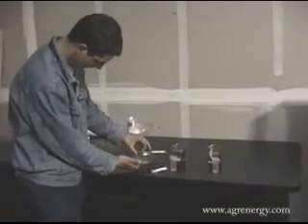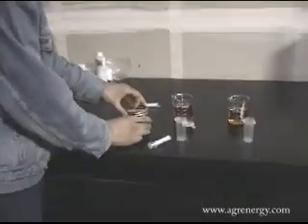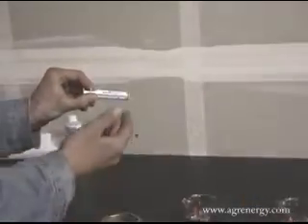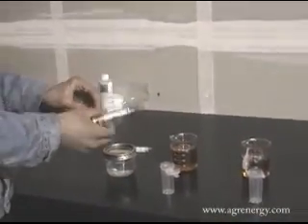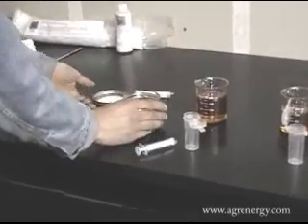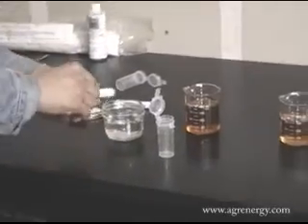So first of all, we have our sample of clean, dry methanol. This is one of the essential ingredients. We have 2 vials. We have a syringe for taking out the sample of the biodiesel, and a syringe for measuring the alcohol. So first, let's take 27 milliliters of this alcohol and put it in one of the syringes.